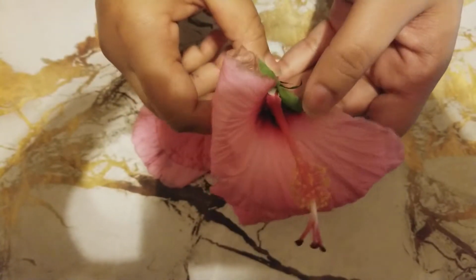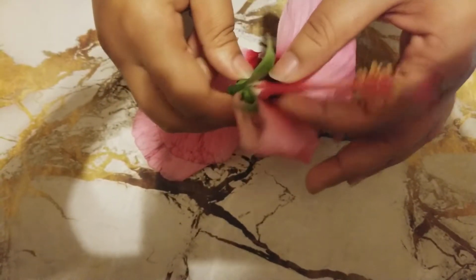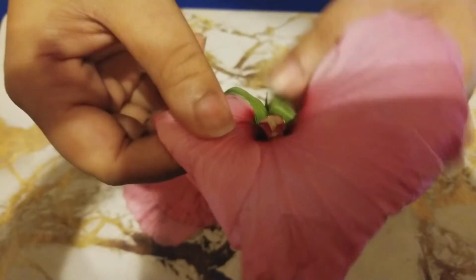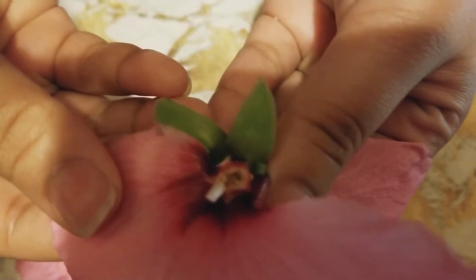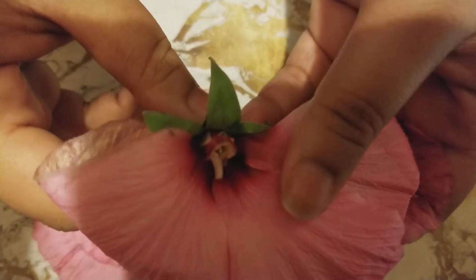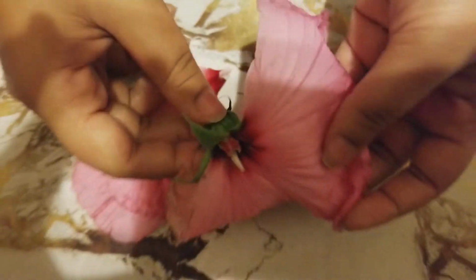One major part of the carpel, which is the female reproductive structure, includes the ovary. Now, if we take off the style right here, over here inside, you have the ovary. The ovary includes the ovule, which, when fertilized, will develop into a seed. A seed contains an embryo and the endosperm, which is the food for the embryo, and a seed coat.